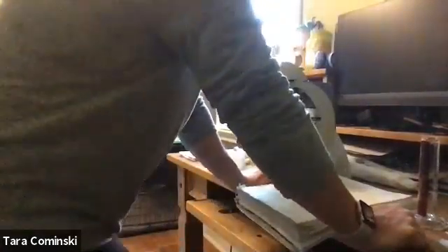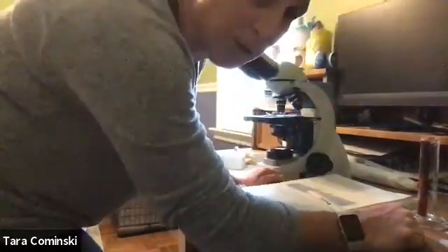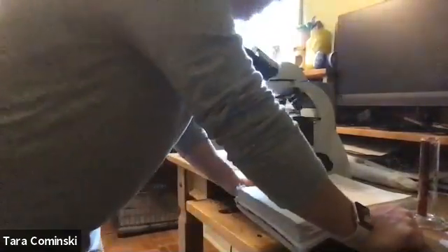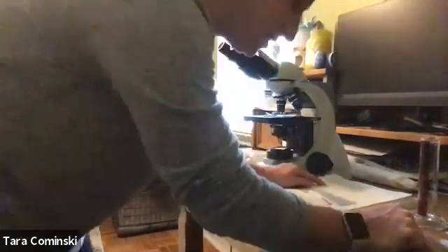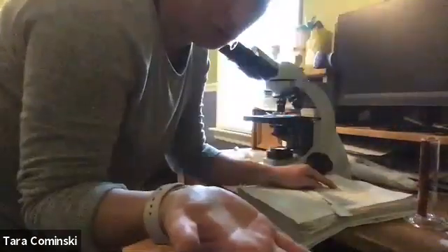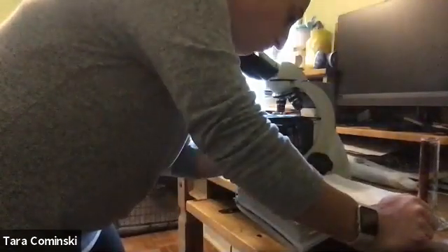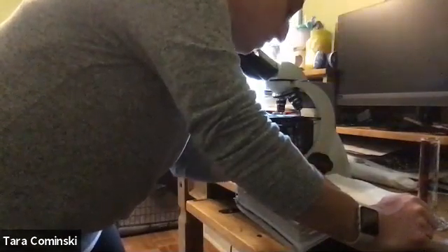So follow that along. Now, number 4 asks us to use a meter stick to measure the distance of 2 long bones. Okay, I don't have those long bones. I don't have a meter stick, but it doesn't matter. You can use the example there. It says, if the bone measures from the 22 centimeter mark to the 50 centimeter mark, what is the length of the bone? Do the subtraction, figure it out, okay? And then, just do it exactly as it's asking you to do there, okay?